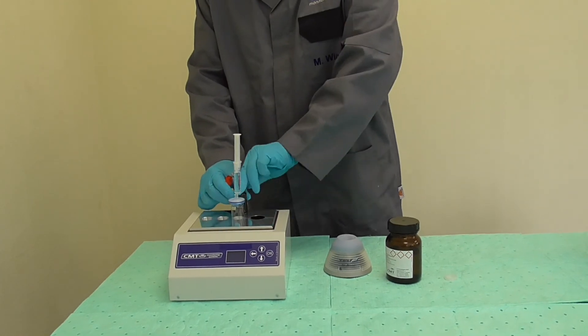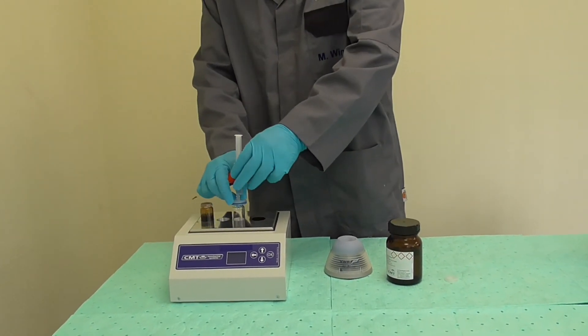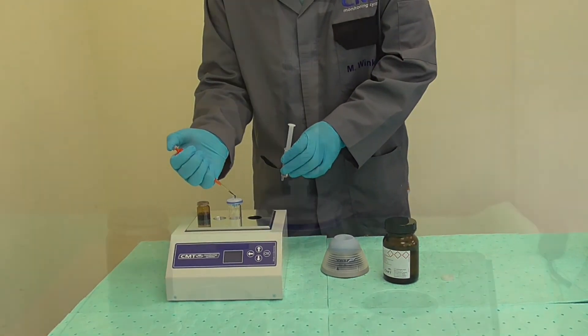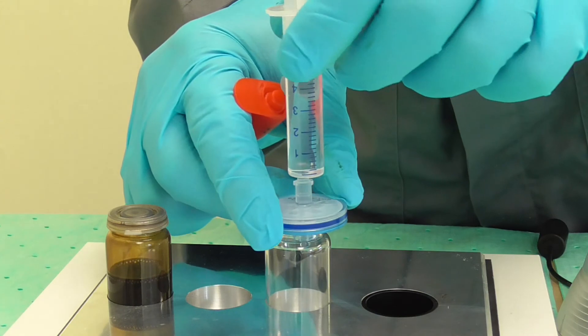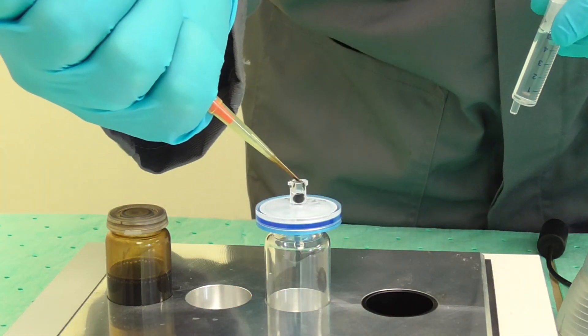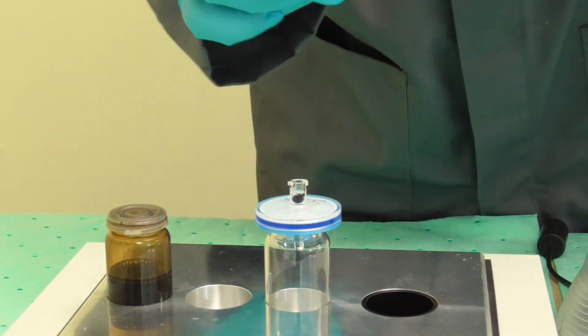Remove the syringe with the remaining 5 milliliter cat fine reagent with one hand and empty the pipette into the hole of the filter syringe flange with the other hand. Press down the plunger of the micro pipette completely. Assemble the syringe again onto the filter.